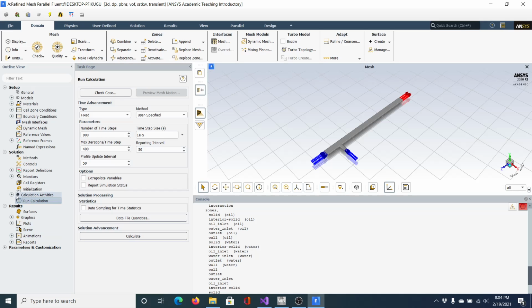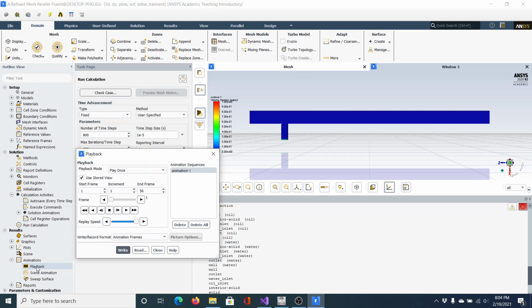Now, I can go ahead and show you how some of the solutions will look. Let me go here. I want to show my animations. So let me do a playback so you guys can see how we are. As you can see, these solutions took a very long time to run. Unless you have access to an HPC facility, I would recommend going back and changing your meshing parameters. I will show you guys though a setup that is better as far as using the meshing if you go back and take out the inflation. So bear with me one second.